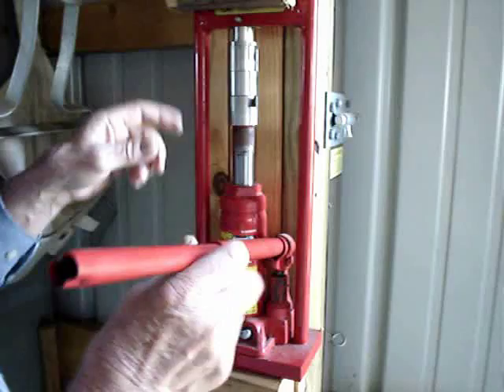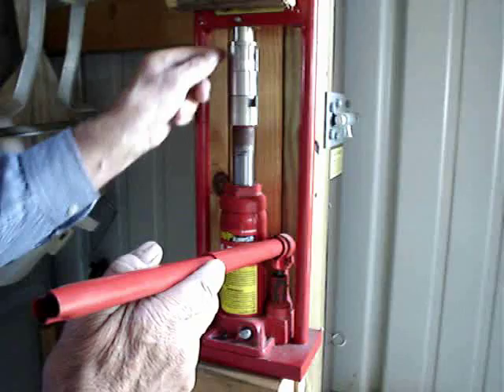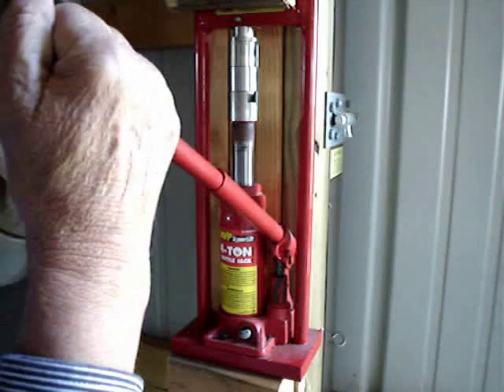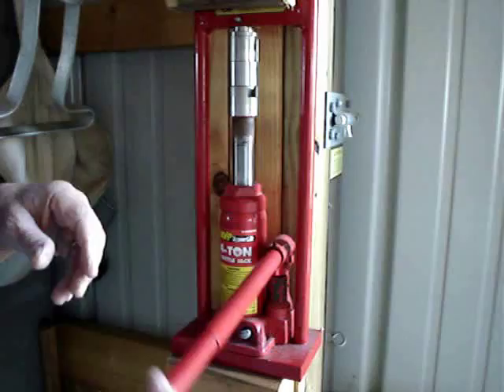At this point the first piston is going down into the first chamber where the grass is. This ring is keeping this piston from going down, so we'll go through the first step. If you listen you can hear it crunching that grass up and essentially breaking it down into just free cells — that's what you hear there.